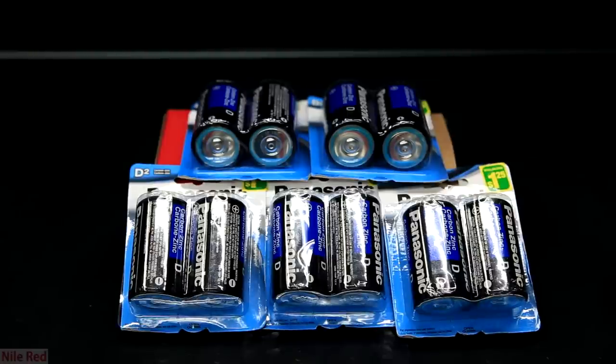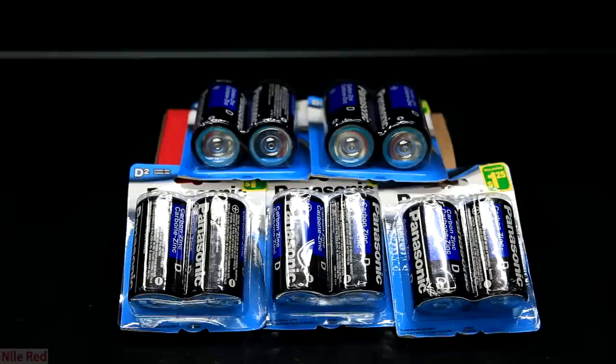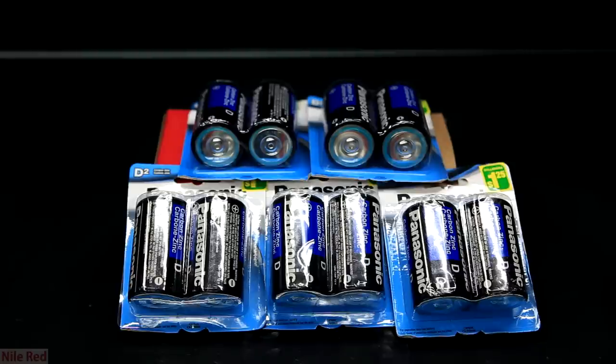So to start off I bought 5 packs of D-cell batteries from the dollar store. These are pretty cheap and I decided to do a lot at once because the process is pretty dirty and I didn't really want to do it again. D-cell batteries are the best ones to get because they're the biggest which means that you have to open fewer batteries to get more.